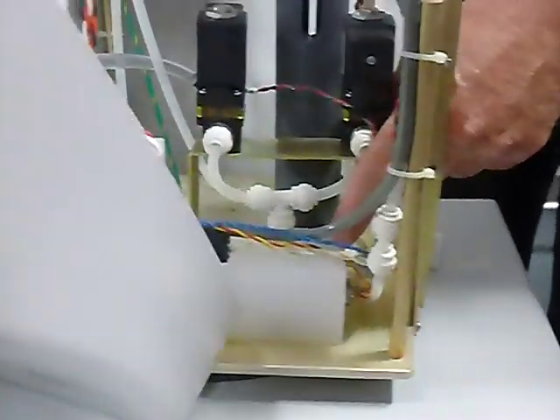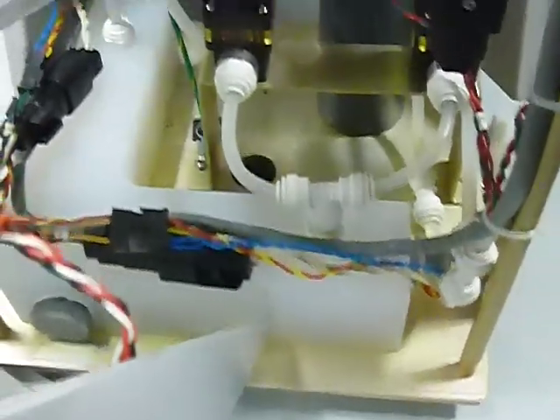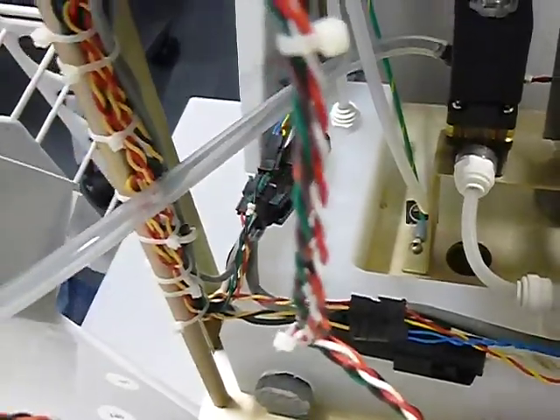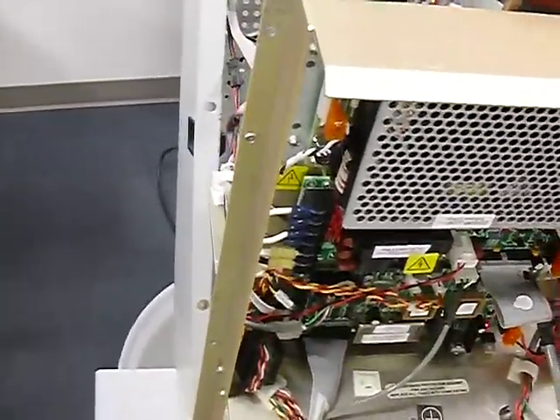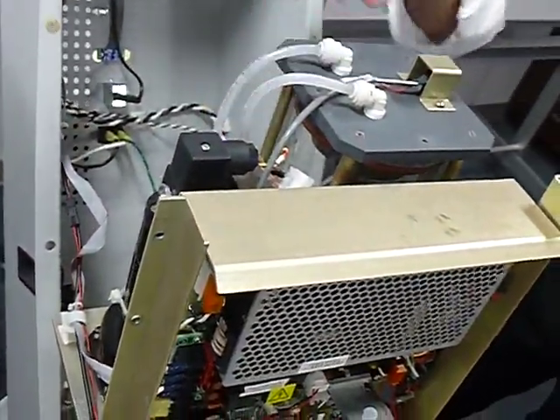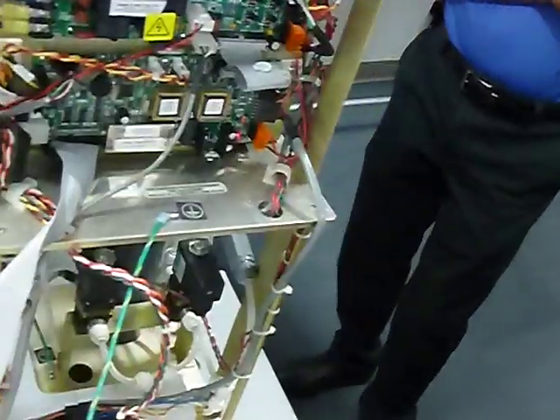Okay, it gets heated once by this heater. It goes through the block, then there's another heater in the back here. All right? And it gets heated out, and it gets drawn up through here, and goes down. Okay? When it's full, it's gonna go back up, back through here, through the heater again, through the other heater again, and then out.